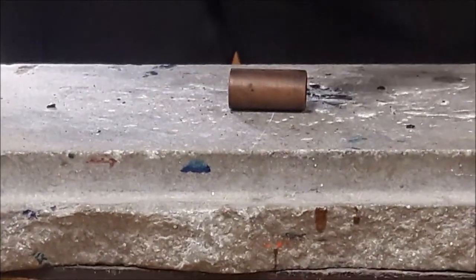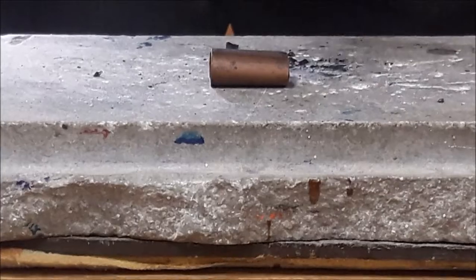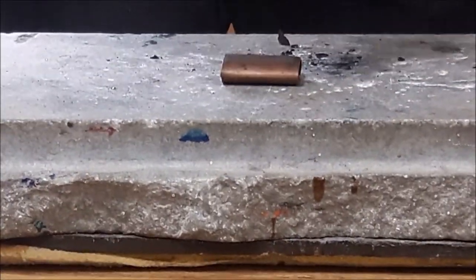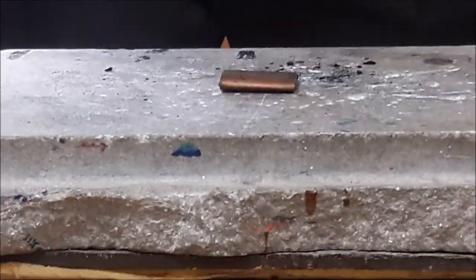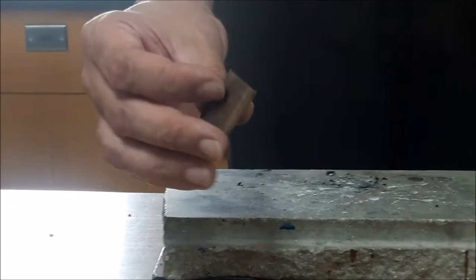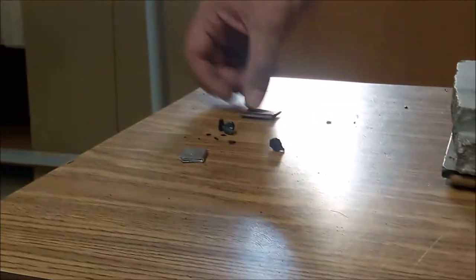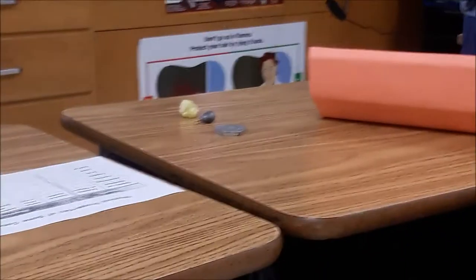Three, two, one. Look at that. Flattened out pretty well. It didn't break. So this is malleable. Don't forget to write that down, guys. Copper malleable.